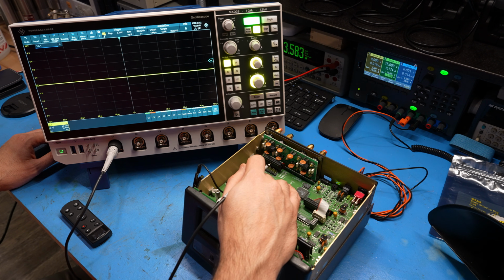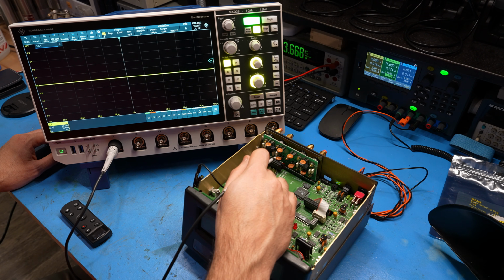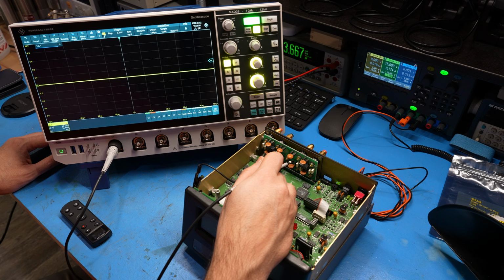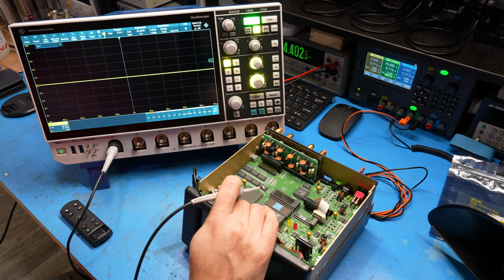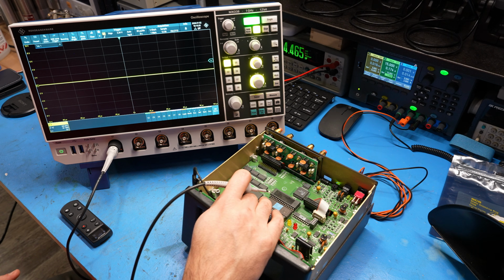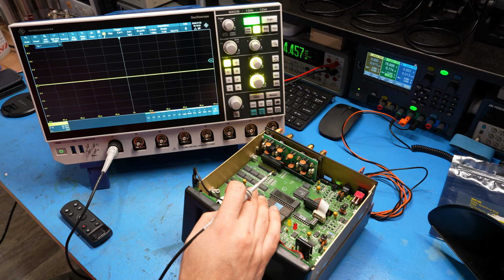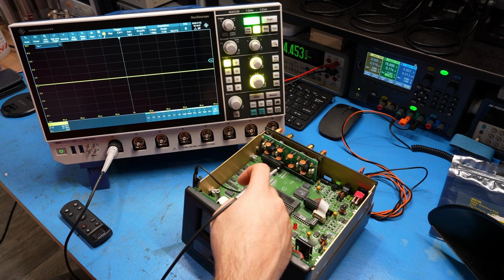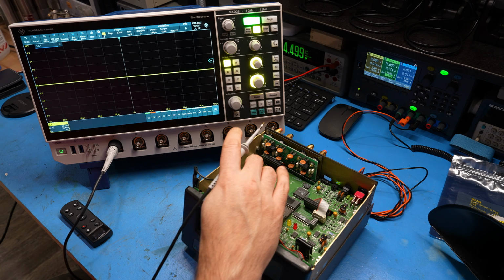Let's replace that. And there's actually another thing here. There's an IC in here responsible for a kind of a watchdog. Let's check that to see if that's working. So there is a management IC next to the microprocessor. This management IC is responsible for providing a reset to the microcontroller if there isn't sufficient activity or there is no heartbeat from the microprocessor itself. This is very useful in situations when you have a battery backup and the glitches may happen. It helps you reset the system without having to turn it on and off, among many other things. So this does provide the reset to this microcontroller.